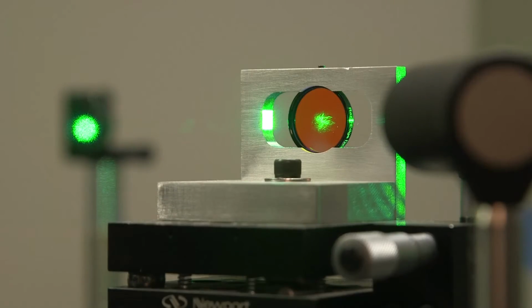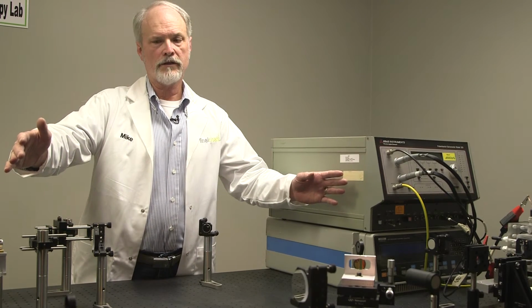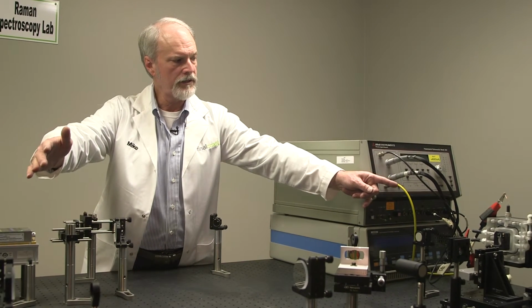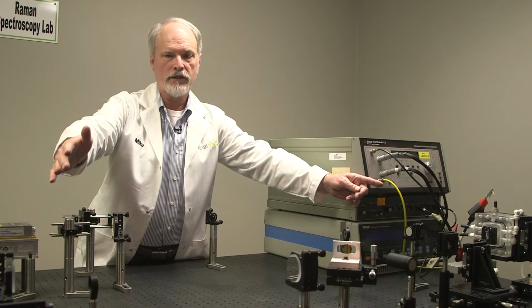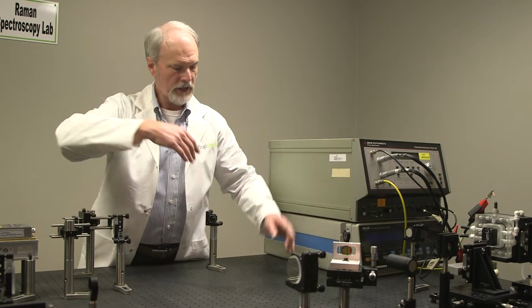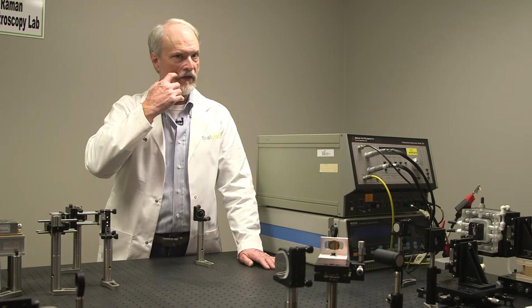It takes a very expensive laser system, and in our case we're doing what's called confocal Raman spectroscopy. And that's the optics that extend from the lens in front of that clear acrylic block over there to my left to the lens going into the spectrograph. And so that's how the light is delivered, and then the shifted light is sent to the spectrograph.